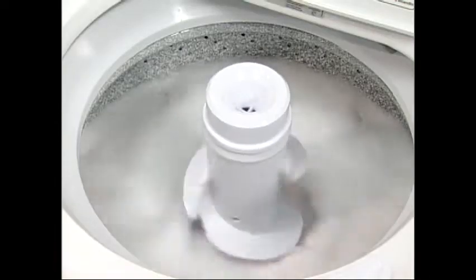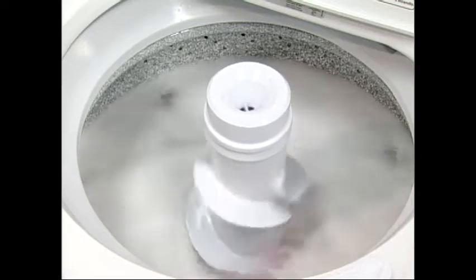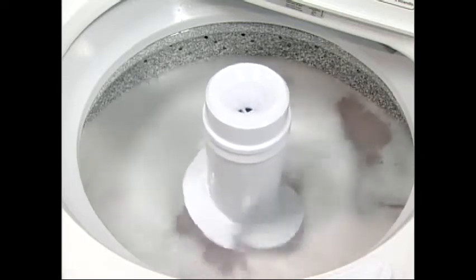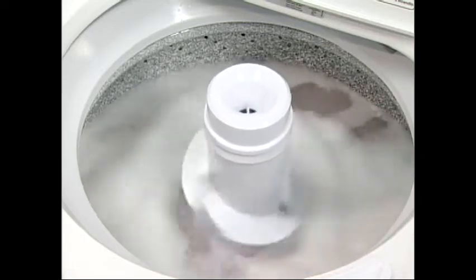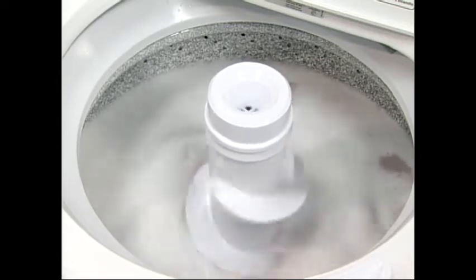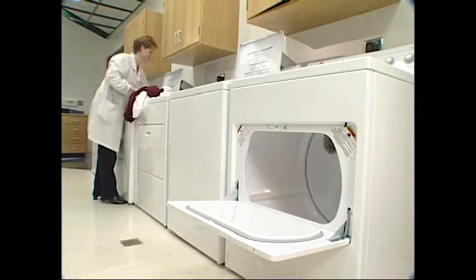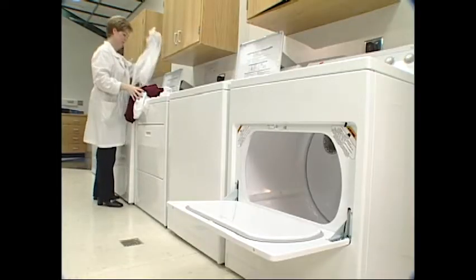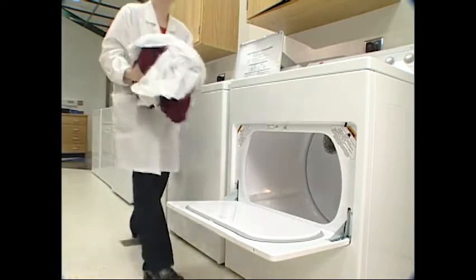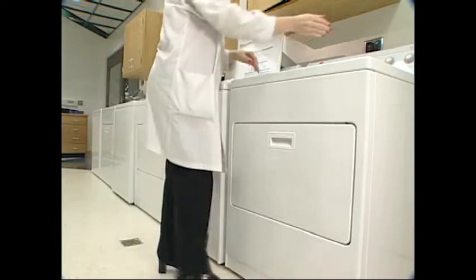In these methods, a home laundering machine is used to wet out the fabric and applies agitation without tension. Wetting out of the fabric without tension allows for initial dimensional changes. However, complete shrinking or growth of the fabric or garment will only occur when drying with mechanical action takes place in the tumble dryer.